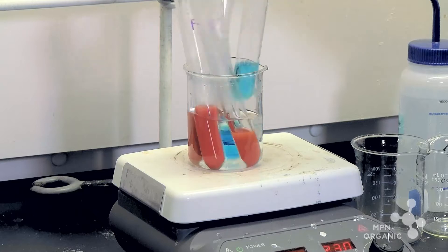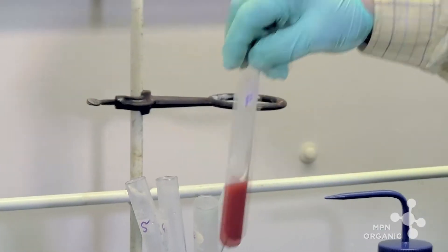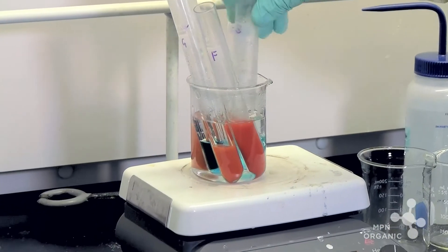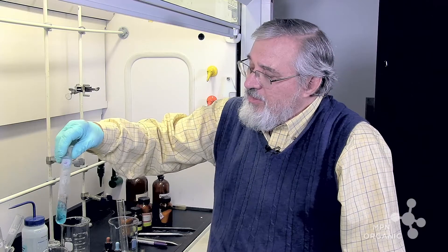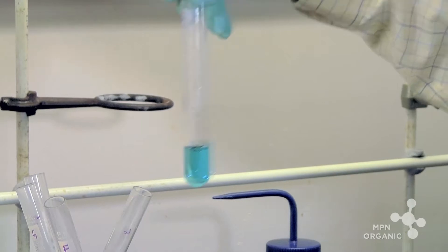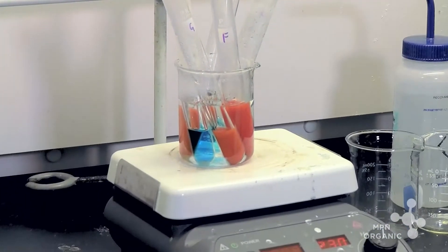Now, glucose and fructose monosaccharides actually make up the sucrose molecule. And so sucrose is a disaccharide which is composed of glucose and fructose. And we've shown that glucose here and fructose itself do indeed change and become, change the copper two ion to copper one. Let's give this a little time for it to convert.